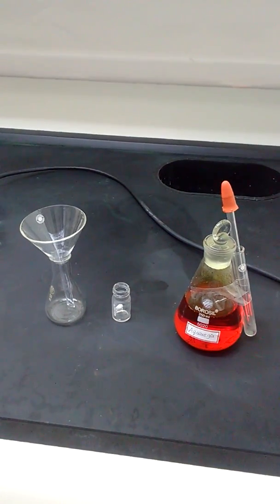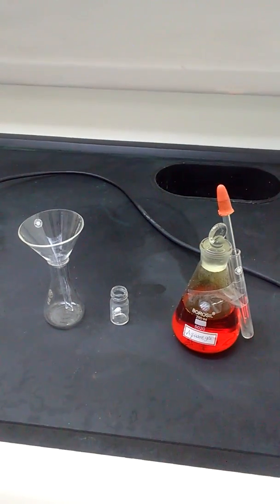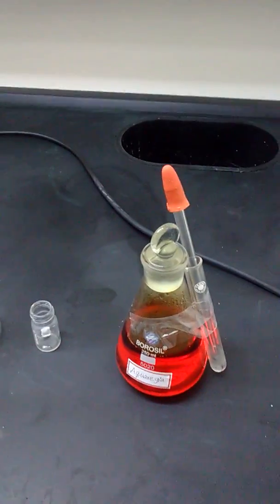Before the experiment, wash all glassware by using aqua regia and rinse with distilled water.